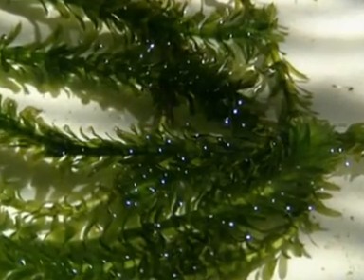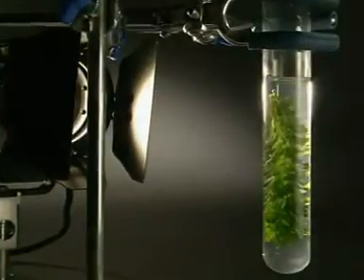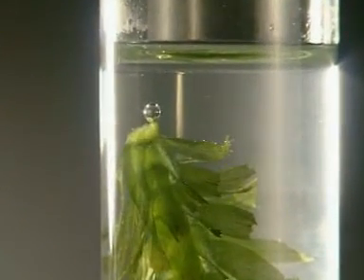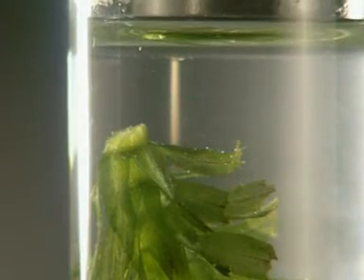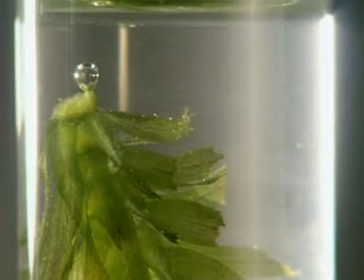A simple way of monitoring the effect of different CO2 levels on photosynthesis is to use a water plant like Canadian pondweed. As the plant photosynthesises, it produces oxygen, which is released as bubbles into the water. The amount of oxygen produced in a given time is a measure of the rate of photosynthesis.